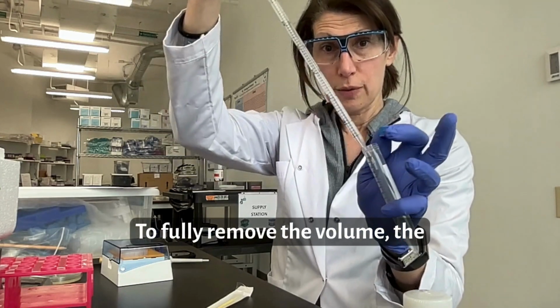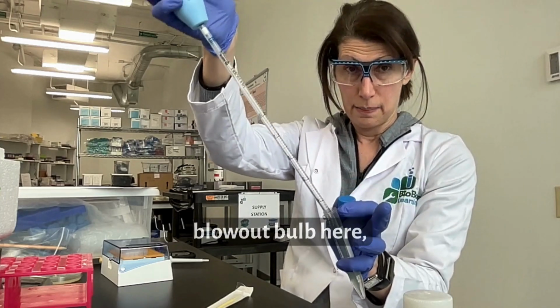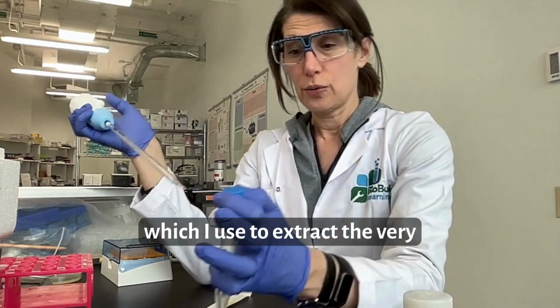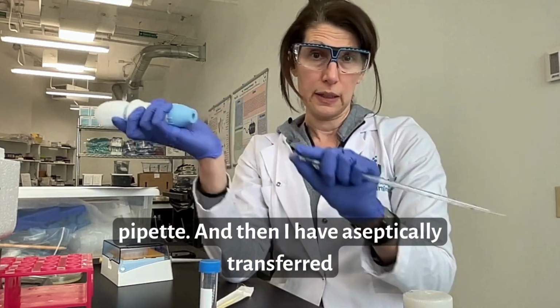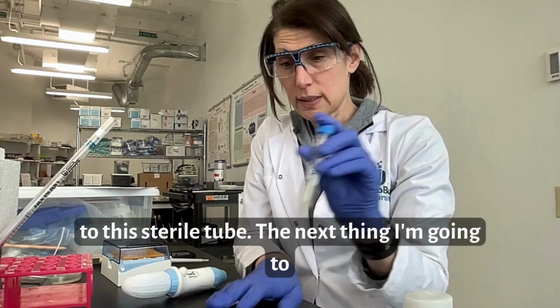To fully remove the precisely measured volume, there is a blowout bulb here, which I use to extract the very last drops of the materials that are in the pipette. And then I have aseptically transferred 5 milliliters of media to this sterile tube.